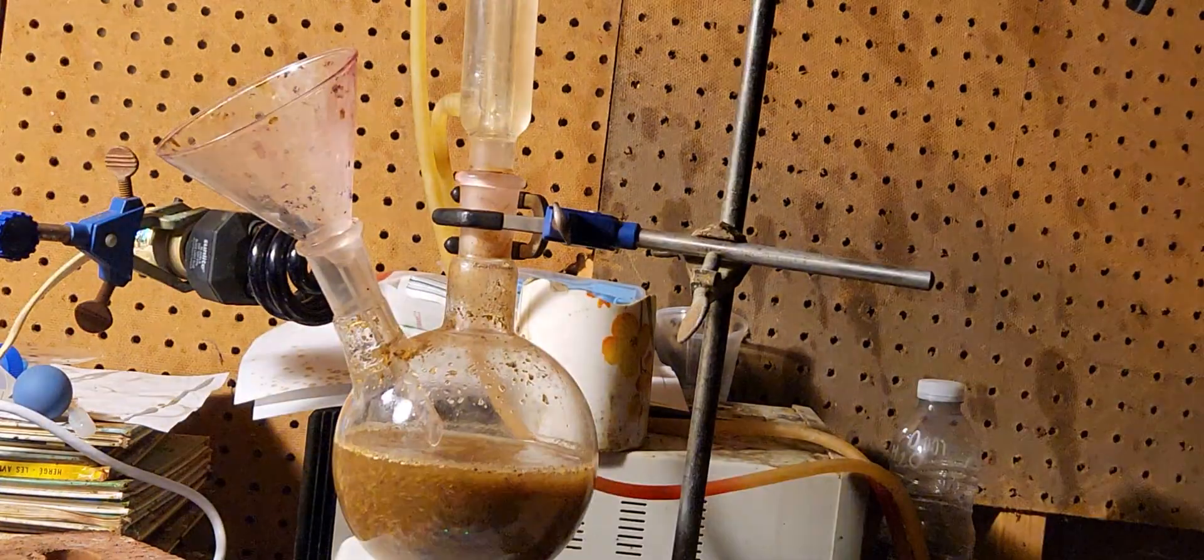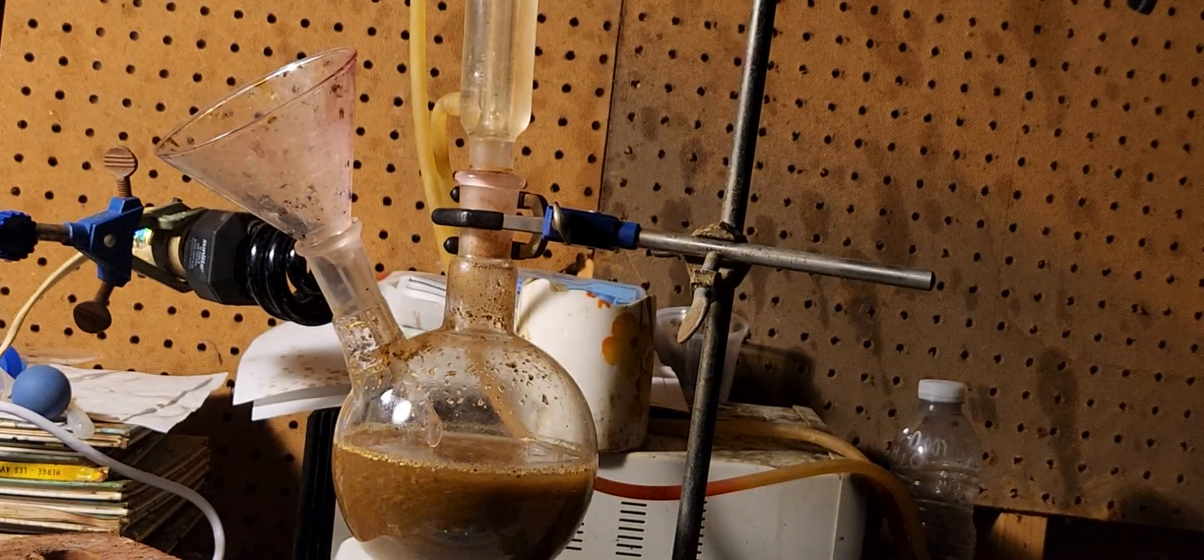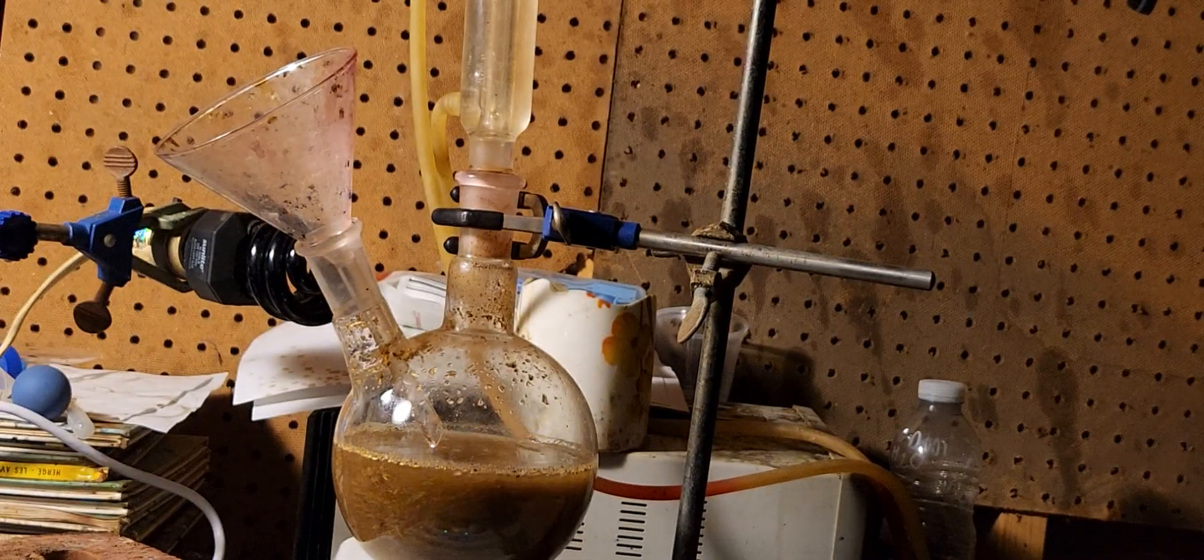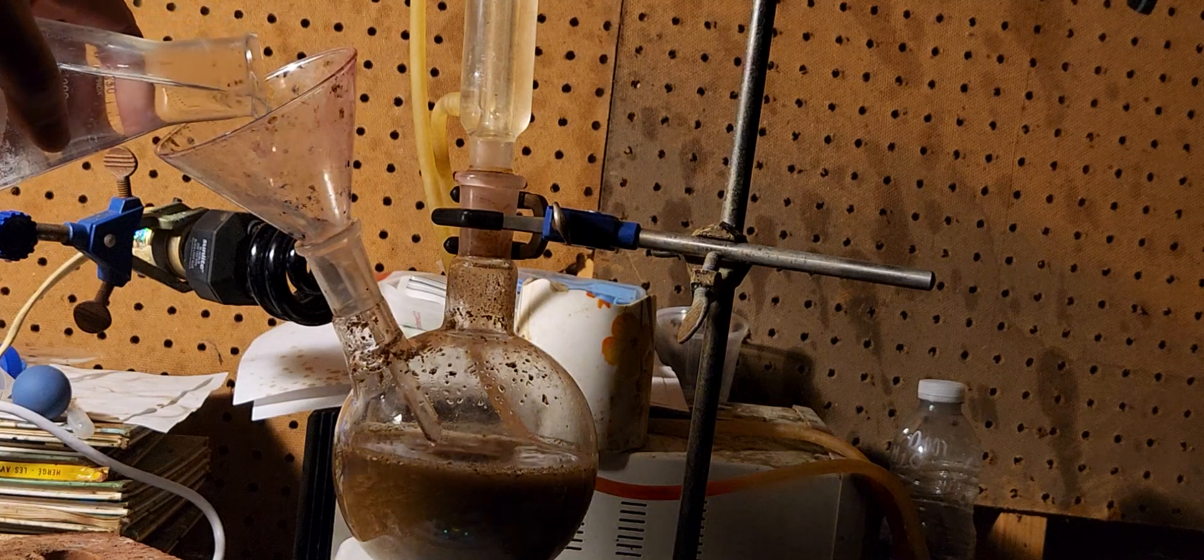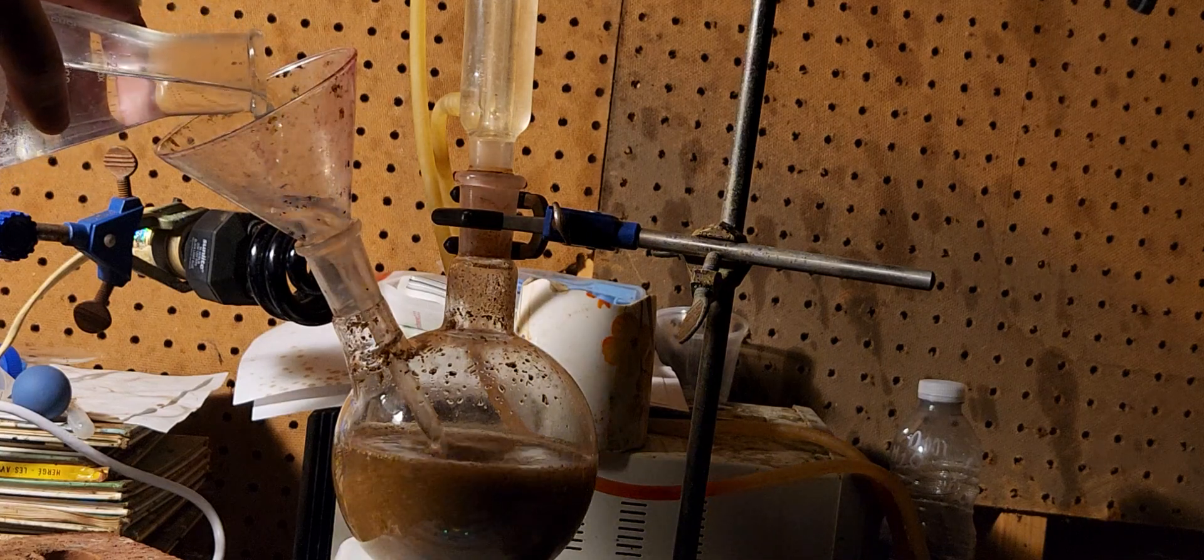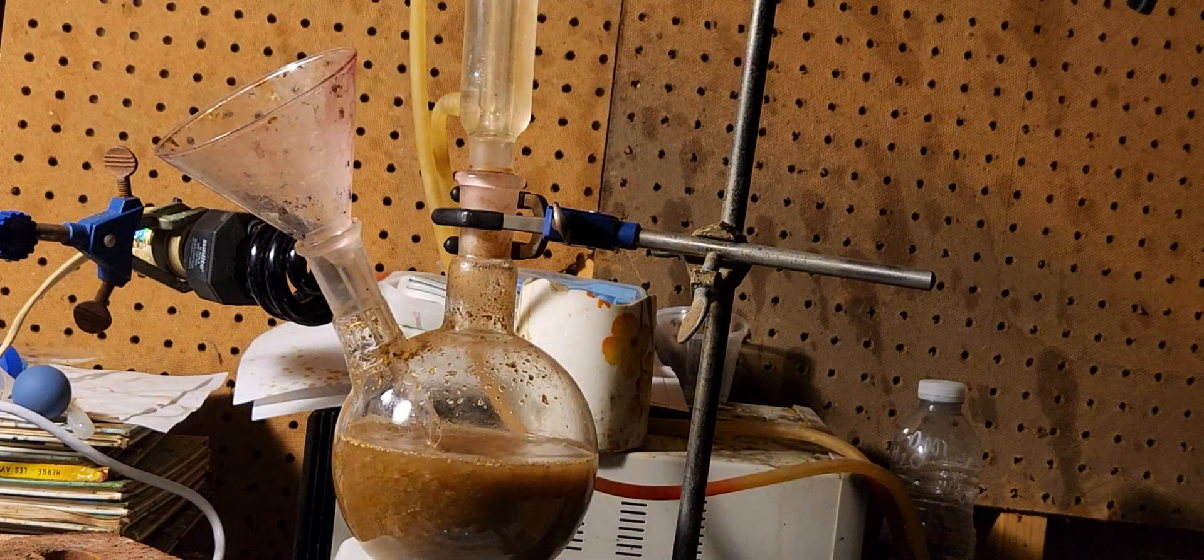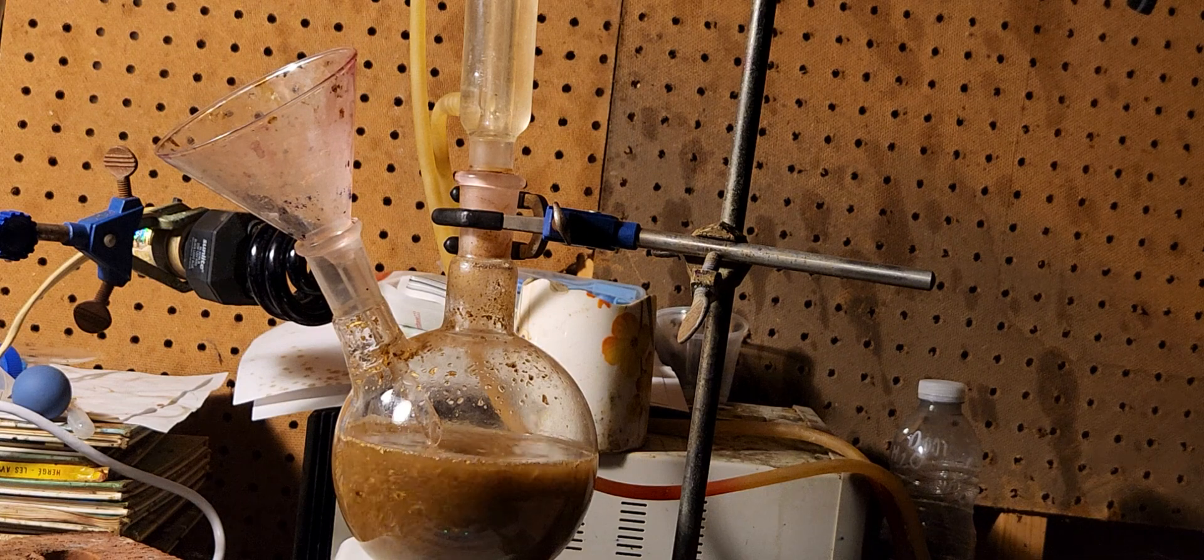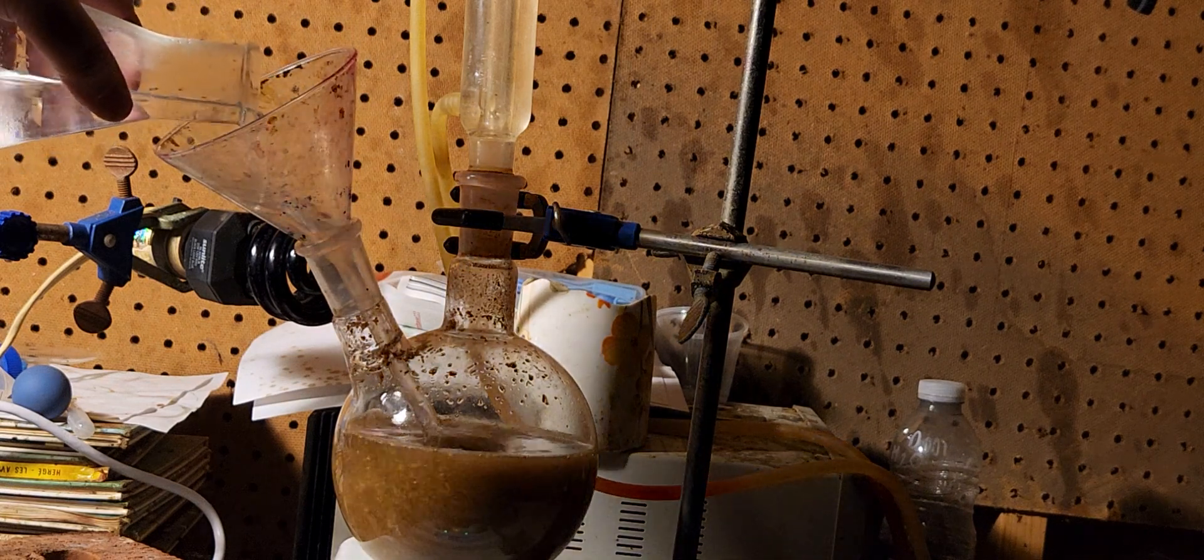This is the acetic acid. Not that bad. I'm just going to add a really small amount. It's too hot. Maybe that's about 50 milliliters. I'm going to add about 100, making it roughly about 5% acetic acid.